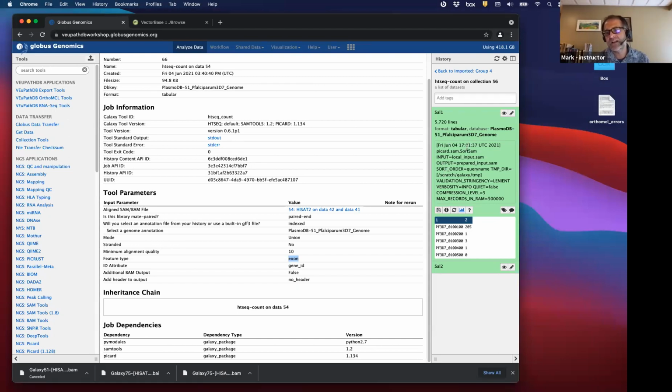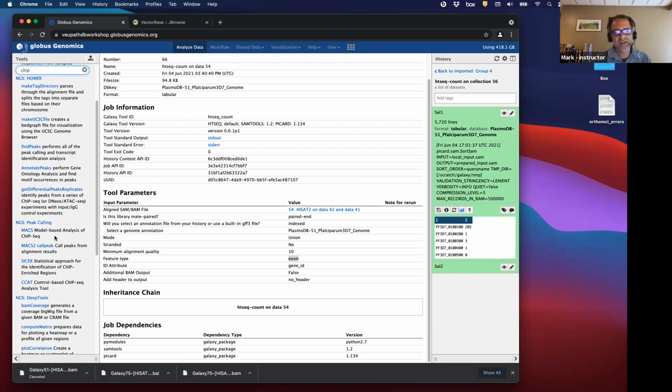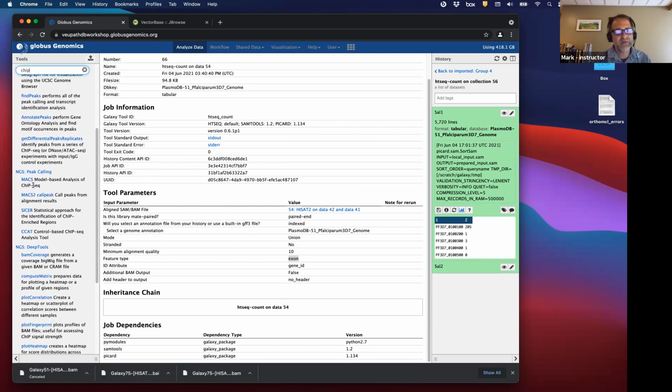A peak calling algorithm, there's lots of them. We might have them here. See the peak call tools, what they do is look in the BAM files and they try to identify peaks in all the reads. So the first thing you're going to have to do, obviously after trimming, is aligning to the genome, using some program, whether it's HiSat2 or something else, to generate a BAM file. You'll have a BAM file, an alignment file, and then you'll feed it to one of these things. Okay. Great.